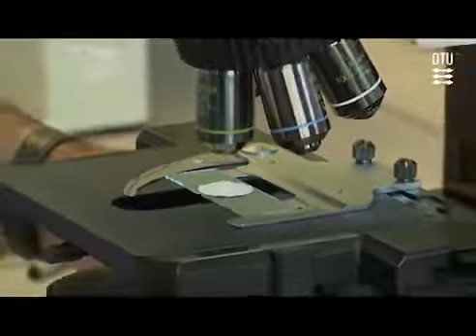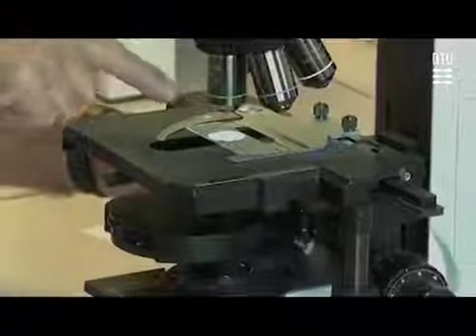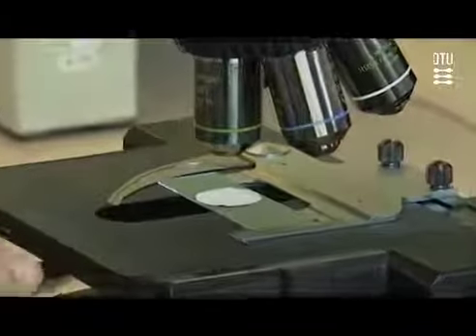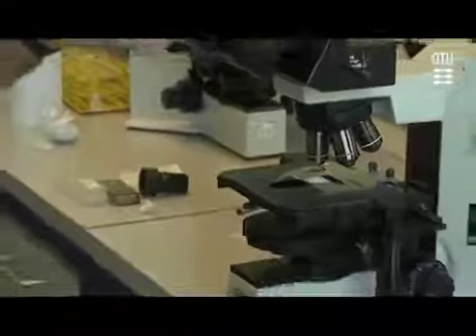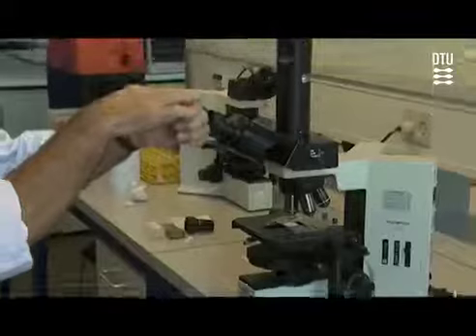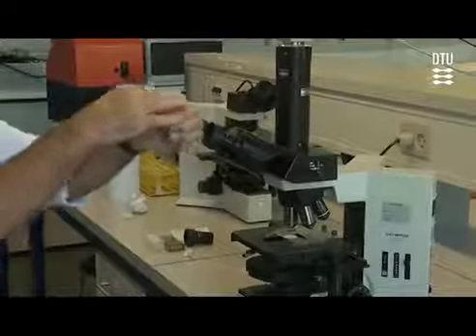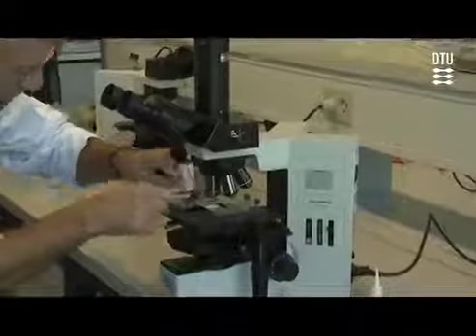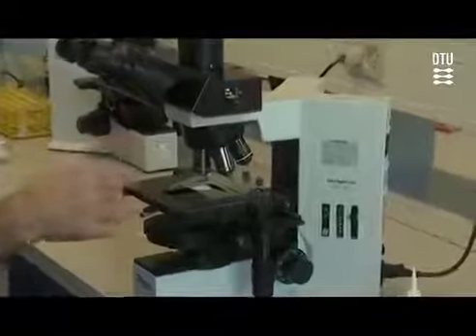And this is exactly what we are trying to show you, because this ring is the clue to how phase contrast microscopy works. When we illuminate through this ring aperture, the cone of light will get smaller and smaller until it hits the specimen, and then it'll be projected up into the ocular afterwards. It's only the ring of light that goes through.